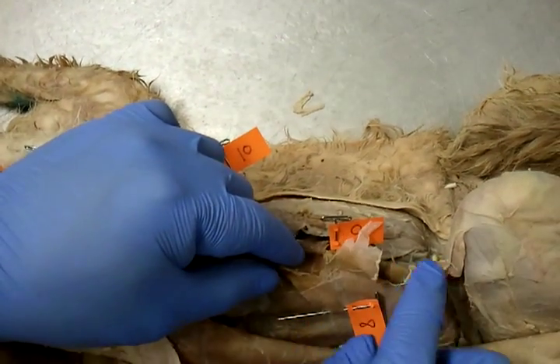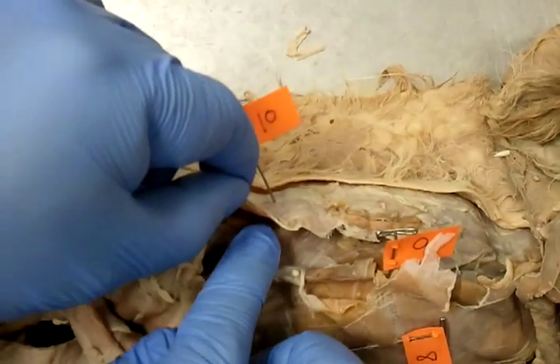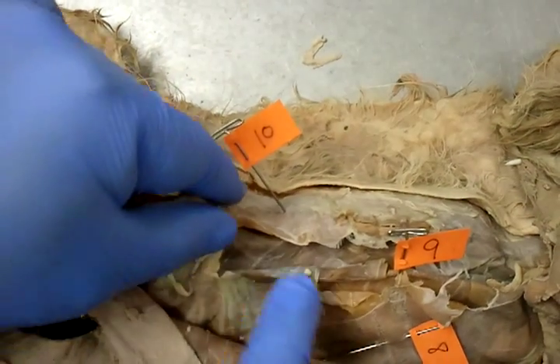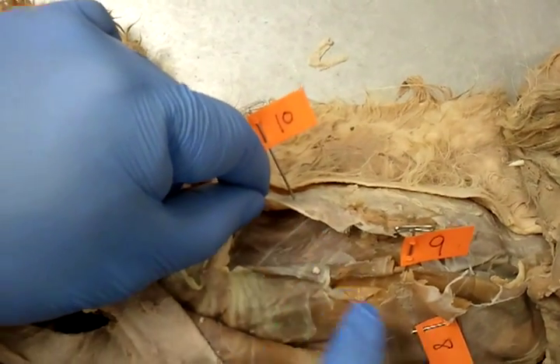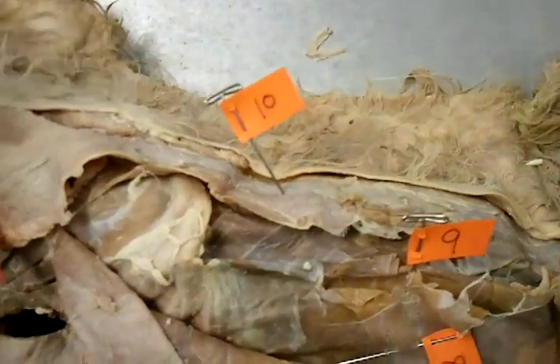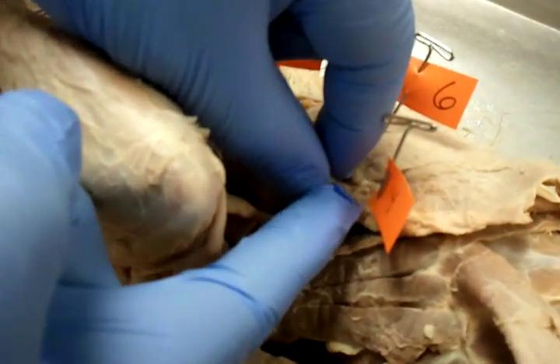Number ten is this other layer that is underneath number seven. Number ten is rectus abdominus — it runs straight up and down into the midline. Moving on to number four.